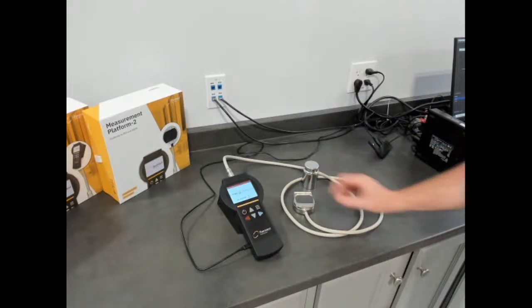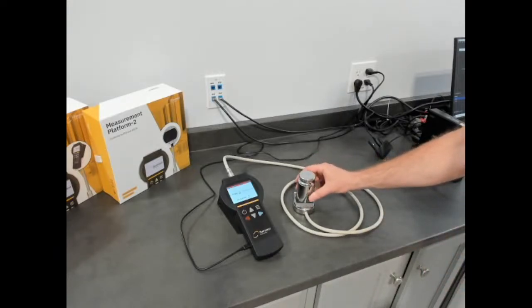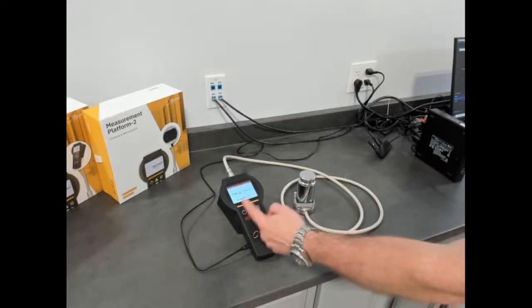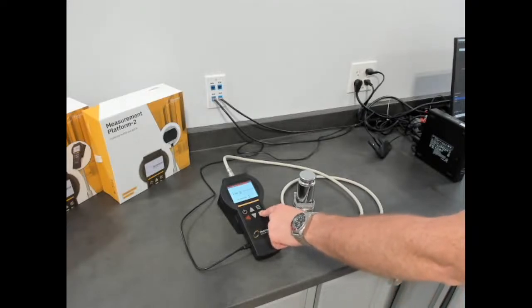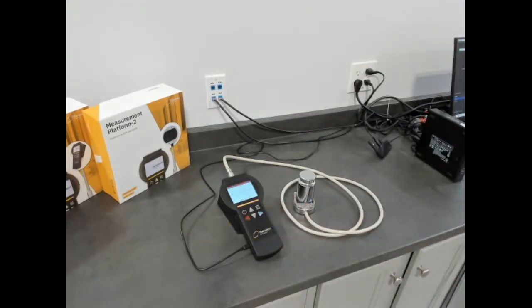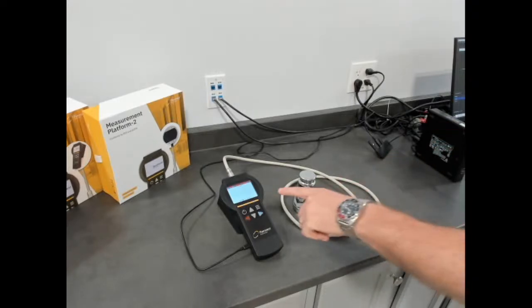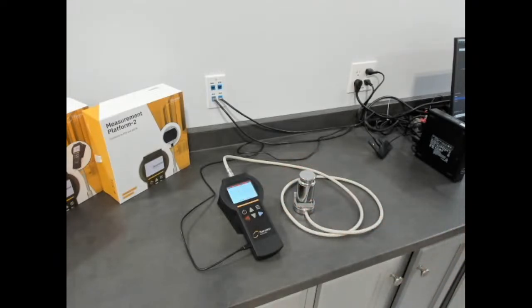So you place your sample on top. This one, you typically just use a weight just because of that narrow range. You can select a single measurement just by pushing the blue button. And what it does is it records drift. So the drift is the environment of the temperature that the sensor and sample are in stable. It records that, so you want a nice random shape, and then it will run the transient measurement and record the thermal conductivity on the device itself, which can be imported into the plugin software, and we can show you that as well.